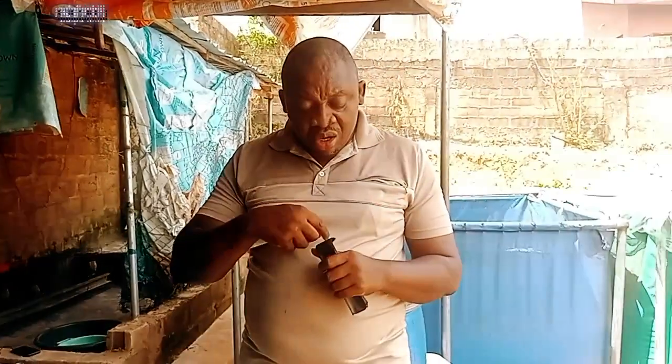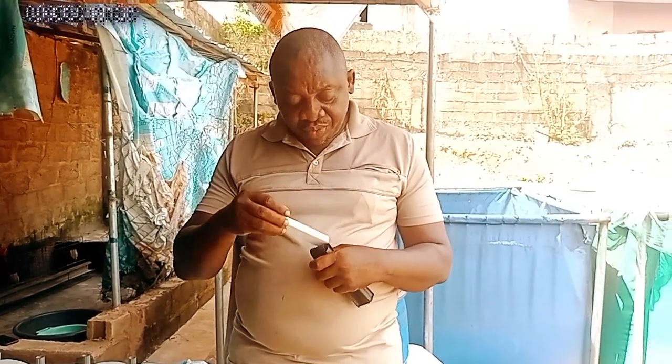This is a digital tester, a 4-in-1 digital tester that can do that for you. This tester will test your water conductivity, your water hardiness, and the total dissolved solids in your water. That means the total dissolved minerals, the total dissolved particles in your water, and the temperature. This tests 4-in-1 in your water.